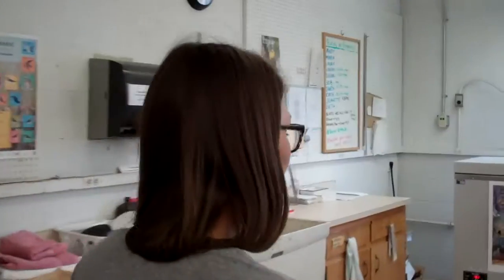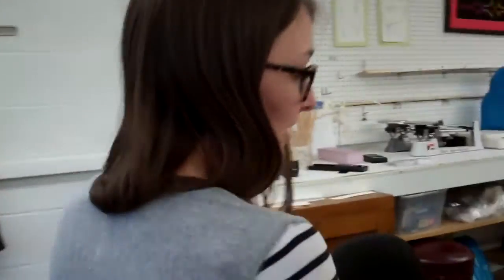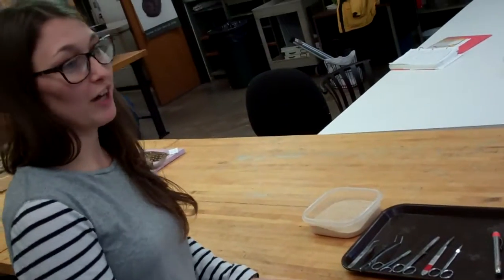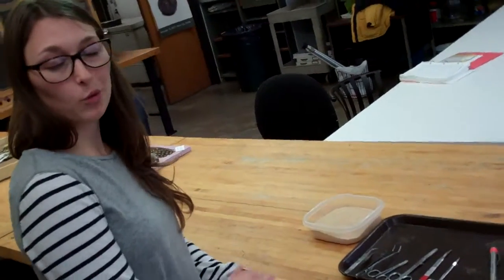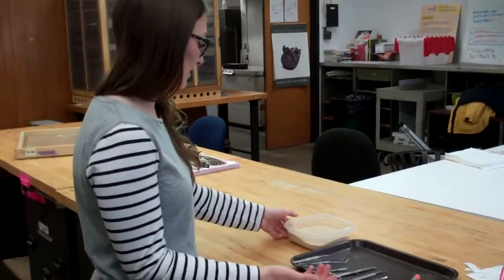Once the birds are thawed, our volunteers will turn them into a research specimen. So here is my prep area. You can see we use very simple tools - this is a very straightforward process. We're doing it the same way now that they were doing it hundreds of years ago, and this is where all the action happens.